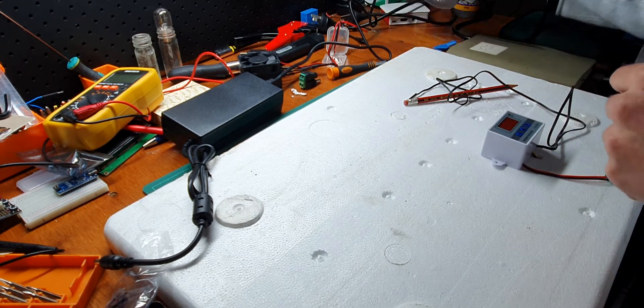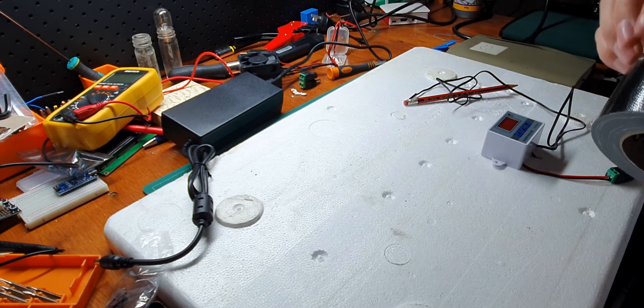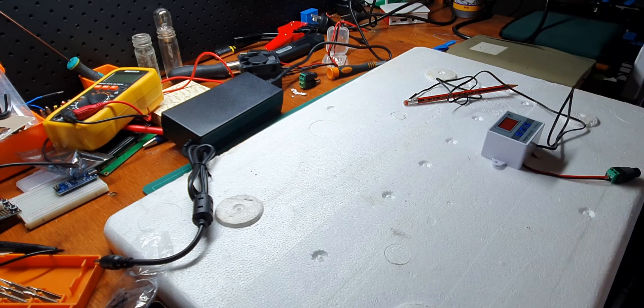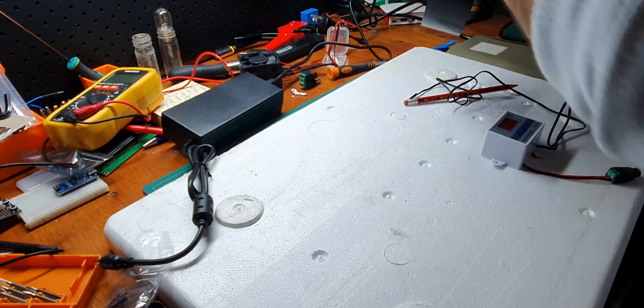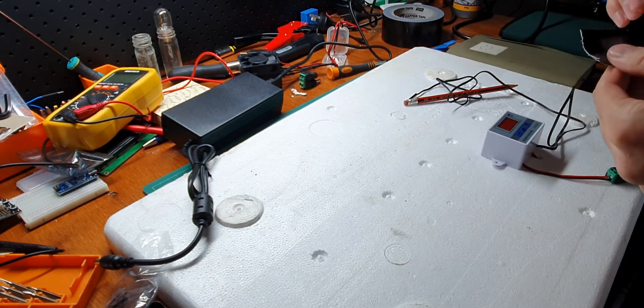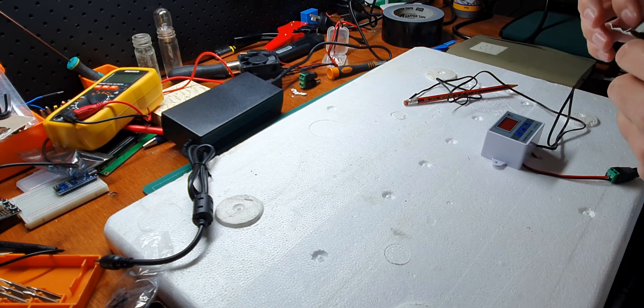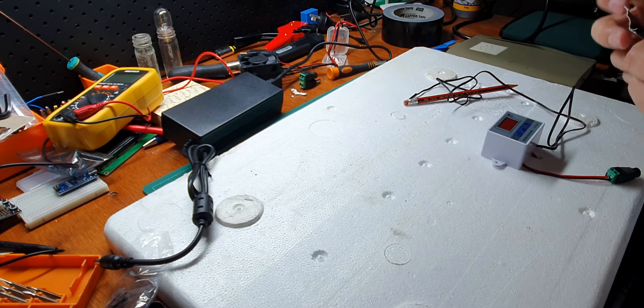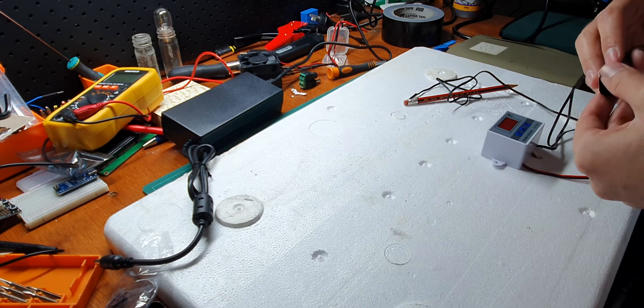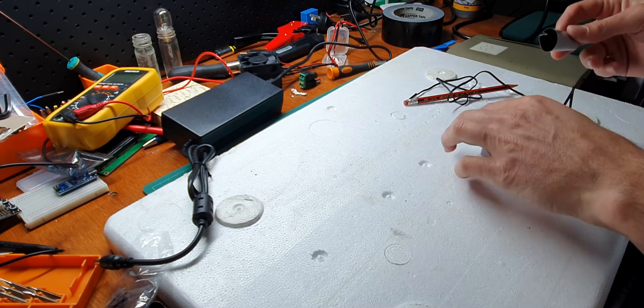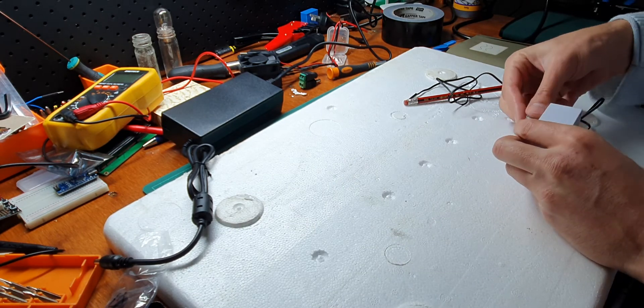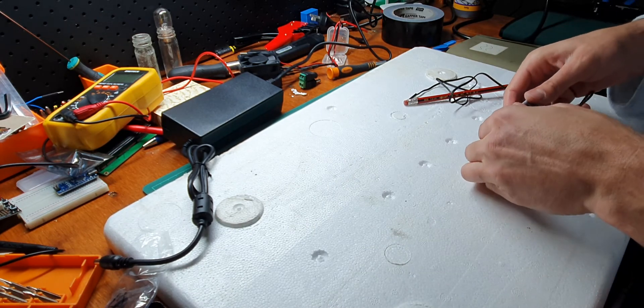I'm having to pass all the wires from the front to the inside of the incubator. Basically I want my incubator to sit up high so I'm putting the controller and the fan on the inside of the lid and hinging the lid with duct tape so that it swings towards me and up when I open it so I can get to my cultures.